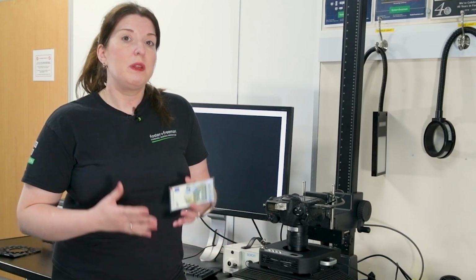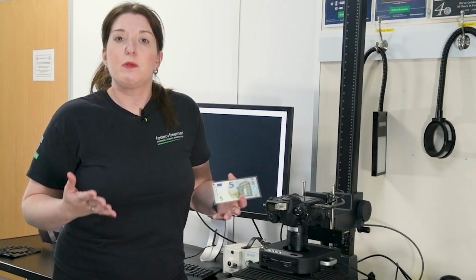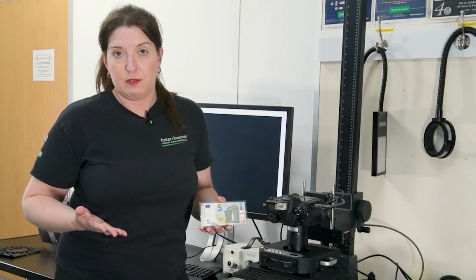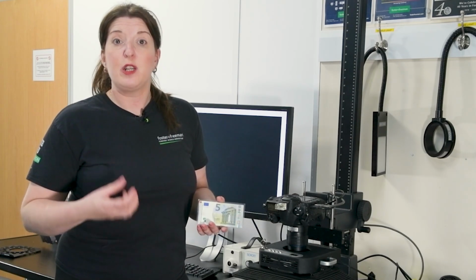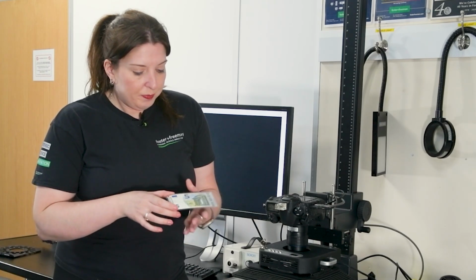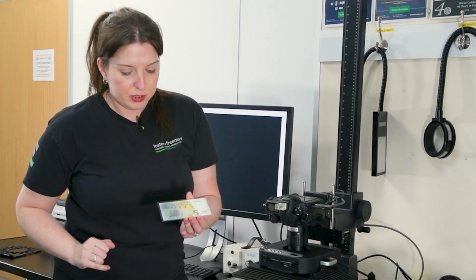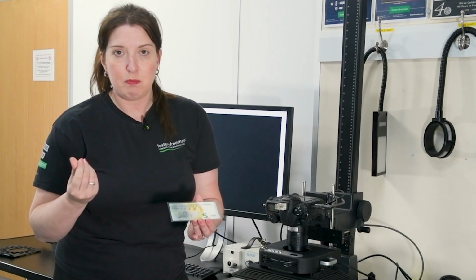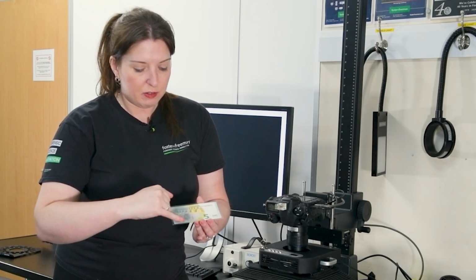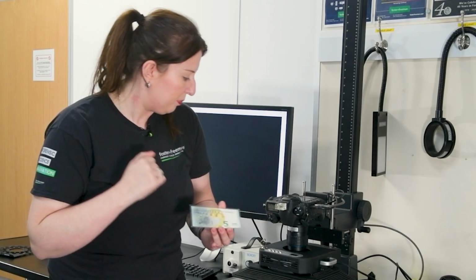Now, this only works with certain fingerprint treatments. So if you ever want to use infrared, one of the things I will say to you is don't try and use or photograph ninhydrin finger marks under infrared, because actually ninhydrin disappears under infrared. So for the examples I have here, in this example, we have a €5 note, and I actually have powdered with black fingerprint powder, just a black kind of granular fingerprint powder, over the areas of the map and on the aqueduct on the top of the banknote.